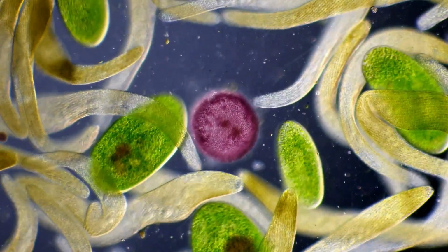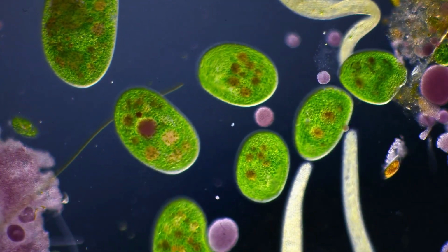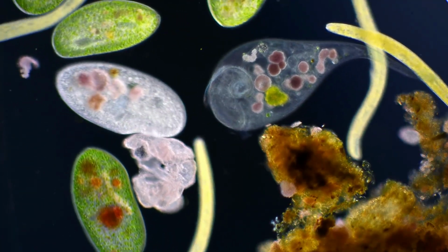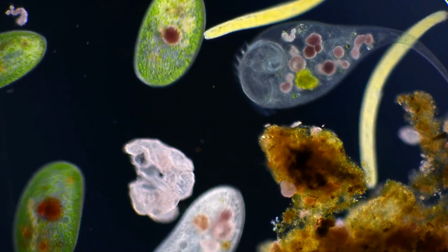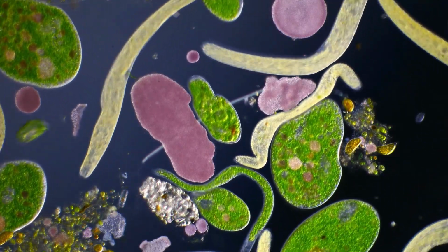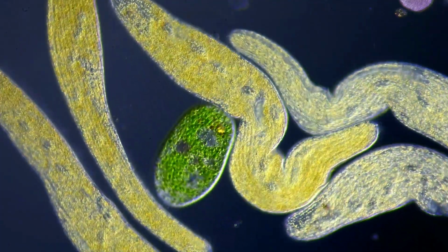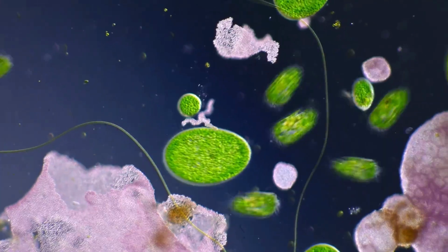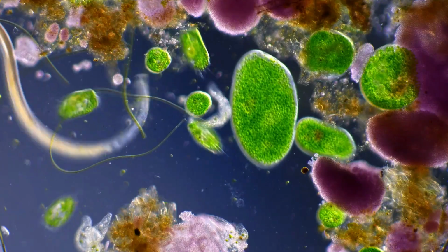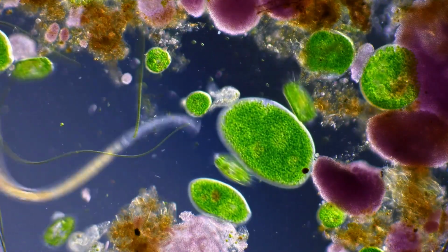When we think about single-celled life, we often picture tiny amoeba-like transparent circular organisms. But life in the microworld isn't as simple as that. Single-celled organisms vary greatly in shape, size, color and function. So in this video, we are taking a closer look at the incredible microscopic diversity in a few drops of water from a single forest pond sample.